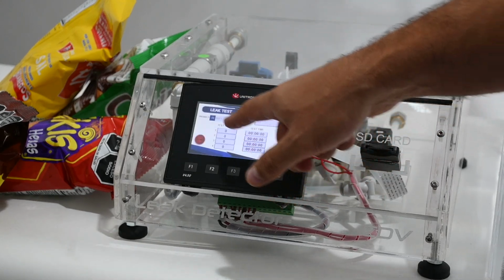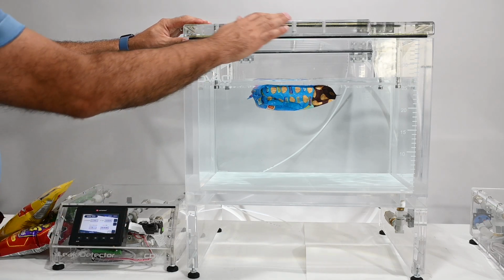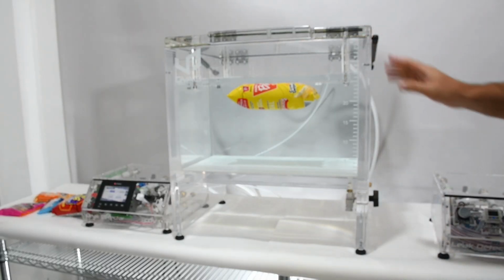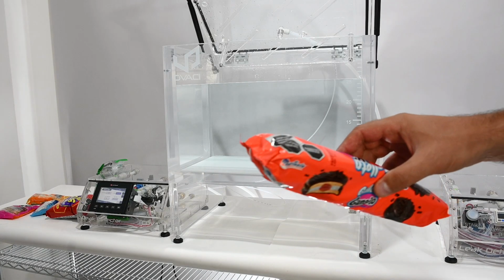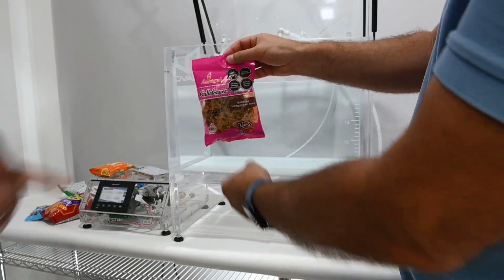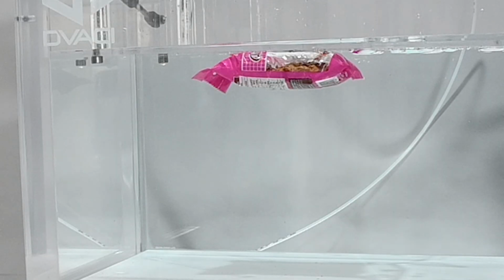I'd like to share with you a behind-the-scenes look at our latest training session with a new sales representative. We used flexible packaging, particularly those found in the food sector, like chips and cookies. During this course, we were really able to manipulate the parameters of our test to see how airtight the packaging was.